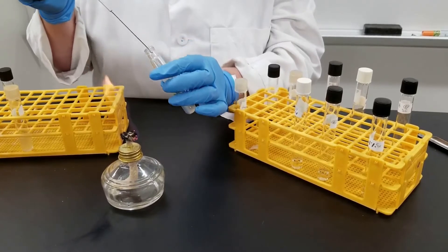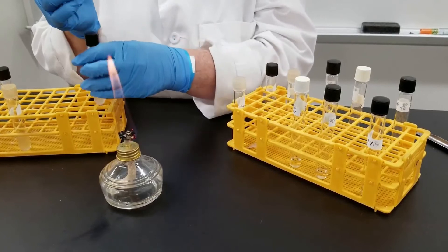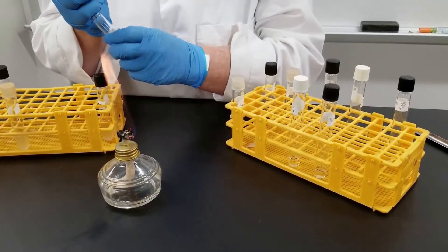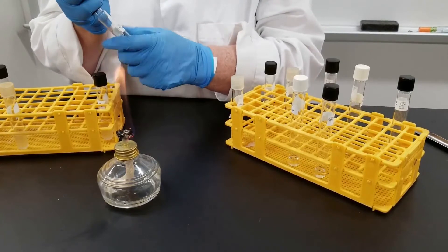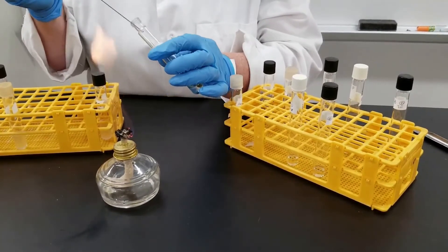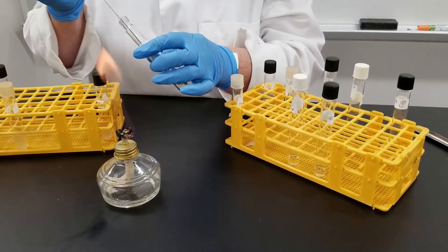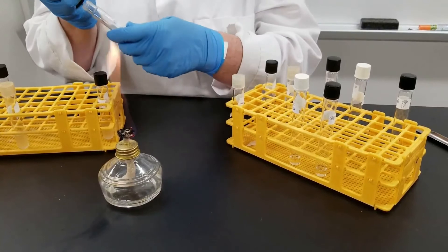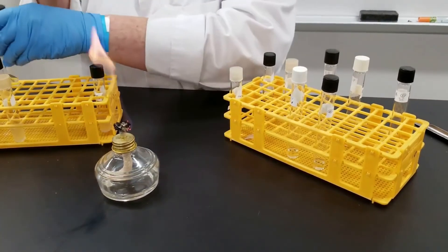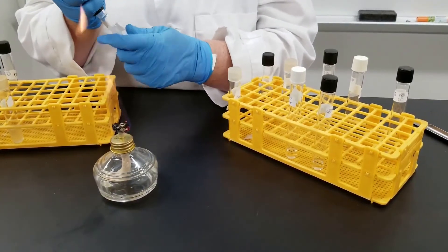Theoretically speaking, if I were using a pipette and starting at the lowest concentration of salt, I could use the same pipette and move up to increasing salt concentrations. But you can't go from high to low, because that would mess up the concentration factor. We will incubate these at 37 degrees Celsius for 24 hours.